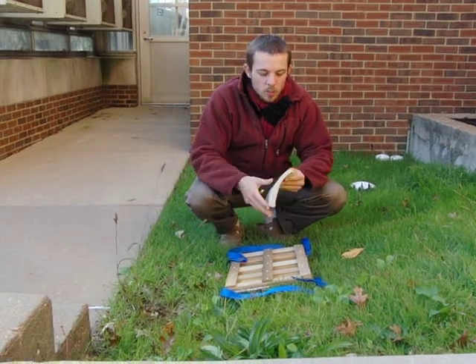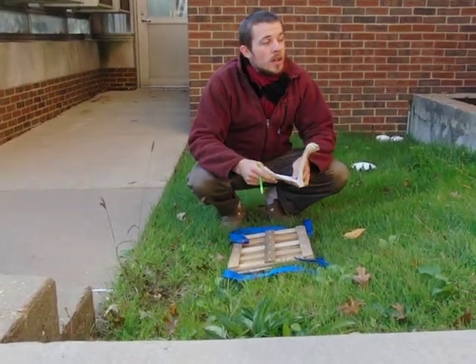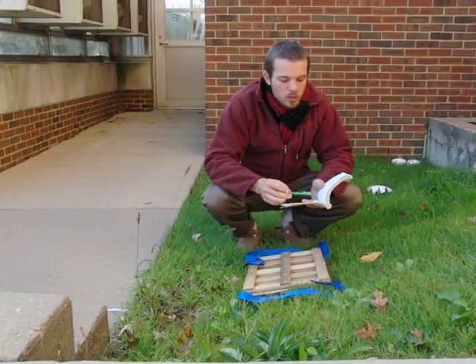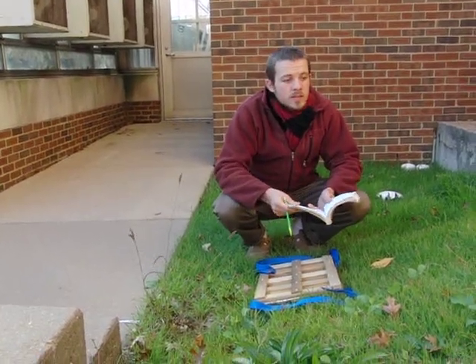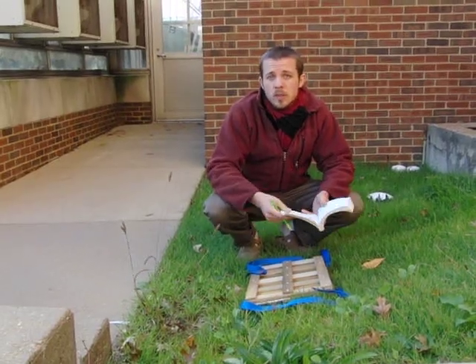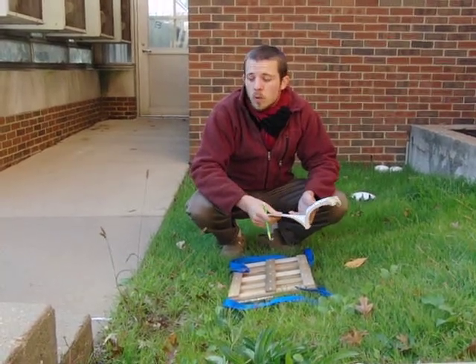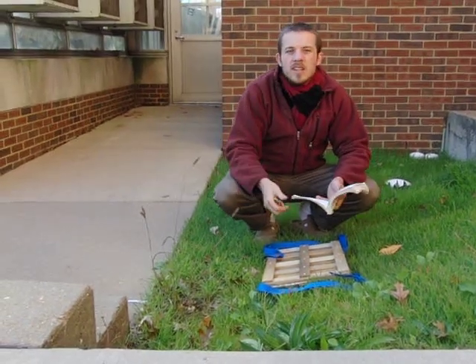I have a collection notebook here. You want to record what it is and where you found it. In this case, we're at the University of Missouri–St. Louis, in front of the Benton building next to the greenhouse. Write that down, note the habitat — for example, growing along a concrete sidewalk — and record the coordinates using a GPS device. If you don't have one, you can note where you collected it and then find the coordinates using Google Maps or Google Earth. Also note any characters you think won't survive when you press and dry the plant — like flower colors. For Setaria you don't really need that, but note if the panicles are drooping, since that doesn't always make it to the sheet.